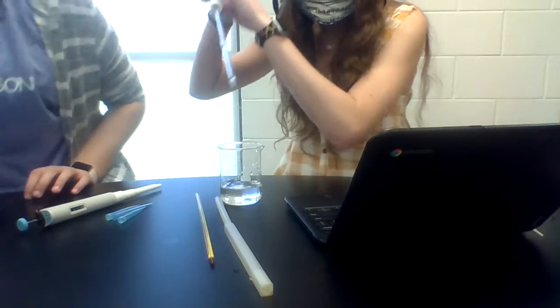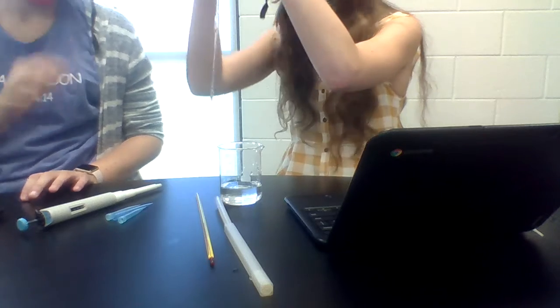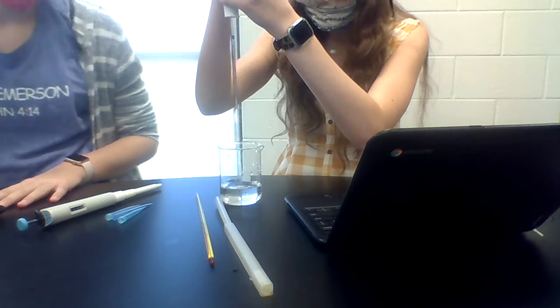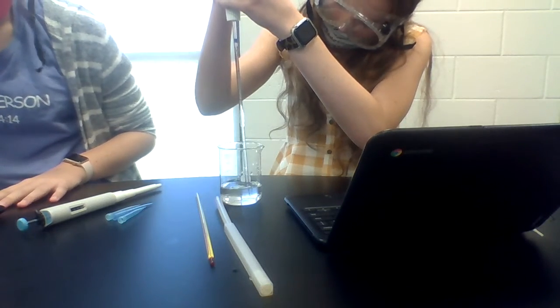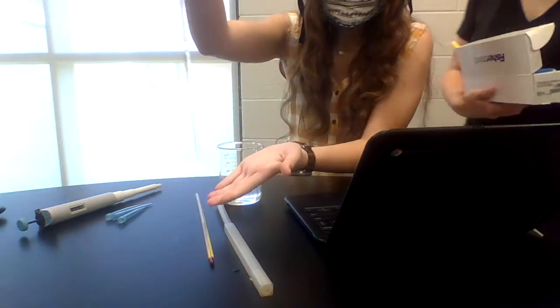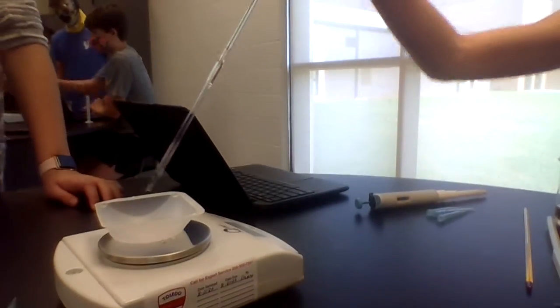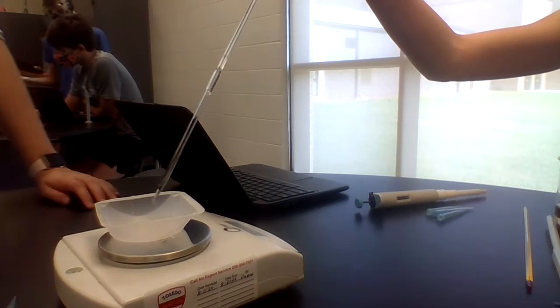We're gonna do this all the way through again. Do you want to do this? No. You don't want to? Okay. Y'all need another micropipette? Oh, there it goes. We're good, we just need some more water. There's a bottle right there. You can use the line. Okay, ready? This is our 3rd milliliter.